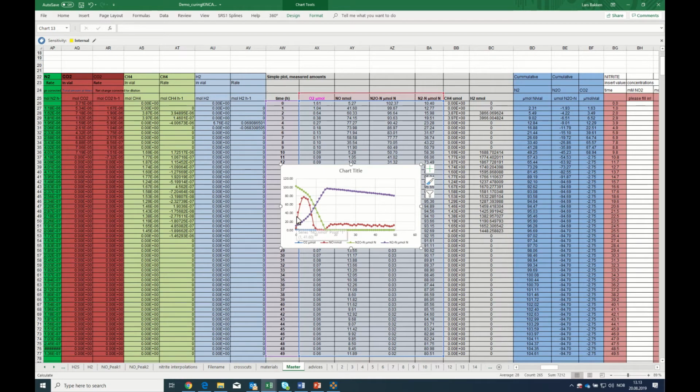fairly fast. They produce nitric oxide, which is then depleting, and then they produce nitric oxide again. It's a bit of a complicated history, but the short version is that they use both N2O and nitrite first, but because they're equipped with NAP, they don't take nitrate before they've depleted the other electron acceptors, and then they produce N2 from nitrate. But the N2 curve here is declining because the production is so low that the loss by sampling is higher than the production rate. But we're not so interested in the measured N2, but we can switch to plotting the accumulated N2, which is the true N2 production estimated by the gas data.